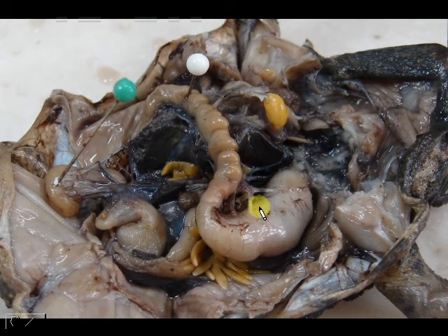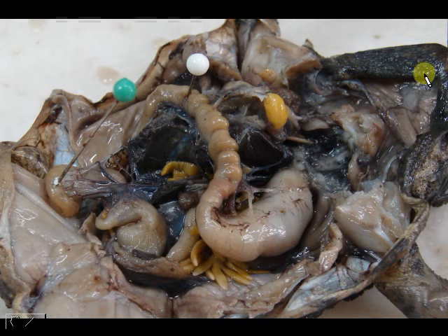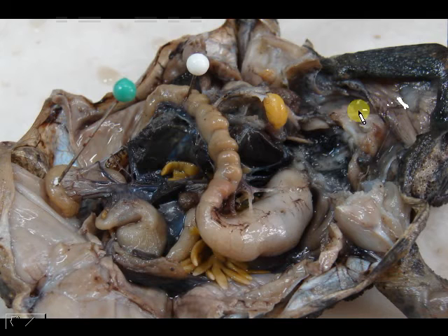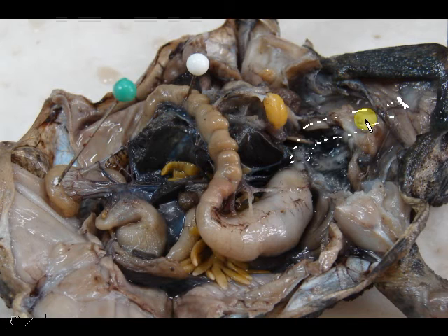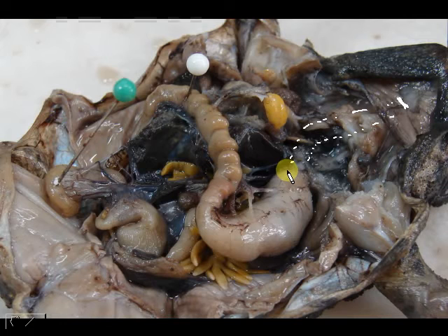We have moved away the liver and the heart to the side so that you can actually see the stomach and the intestine. The food enters the mouth and then enters by way of the pharynx, which will eventually lead to your esophagus. The esophagus of the toad is pretty short, and the food passes through the esophagus and then finally makes its way to the stomach.